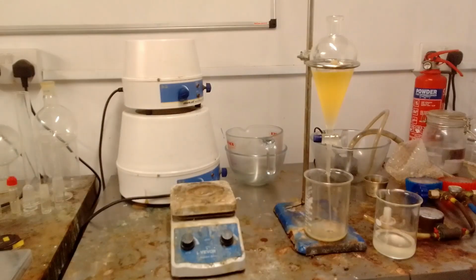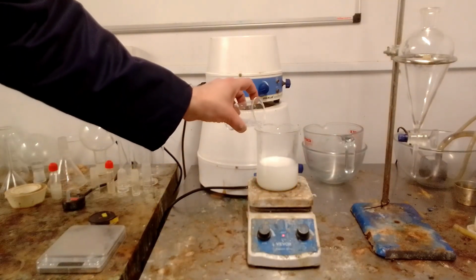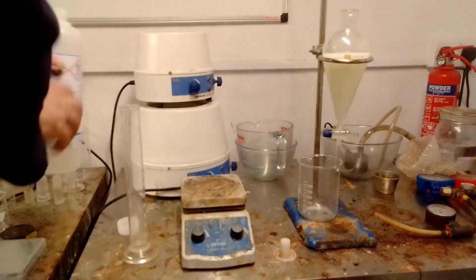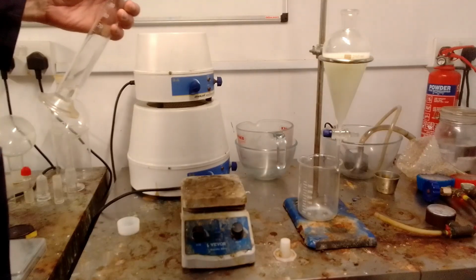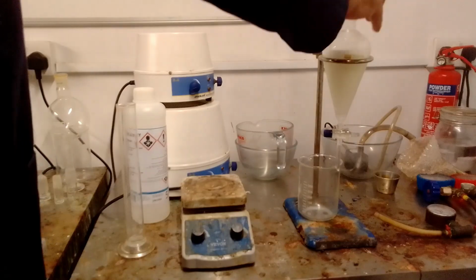Because perchloroethylene is very dense, around 1.7 grams per cubic centimetre, the aqueous layer was on top. The potassium carbonate solution was then added to the aqueous layer, causing the yellow solution to lose its colour and a great deal of insoluble colloidal material to form. The milky solution was extracted with 3 portions of DCM, which in this case was the top layer due to the high concentration of salts in the water phase.